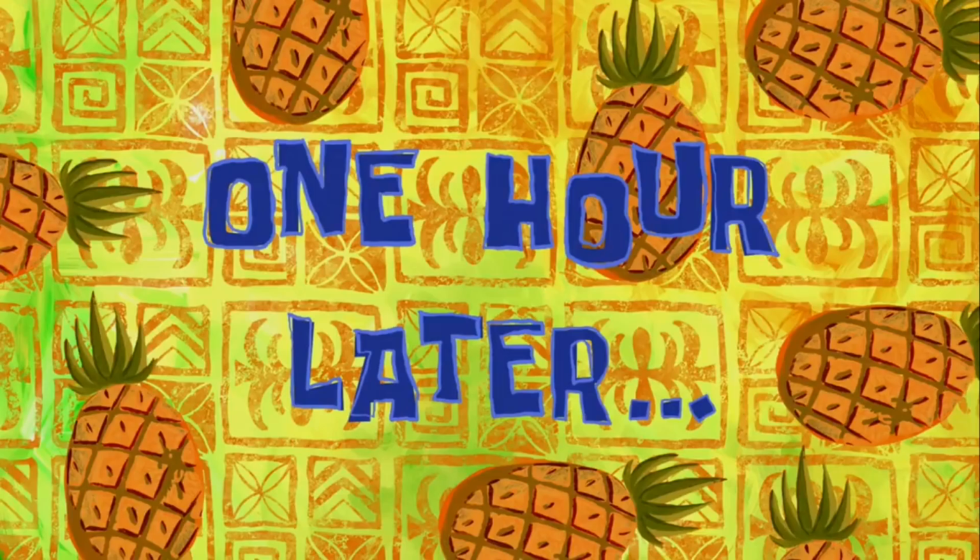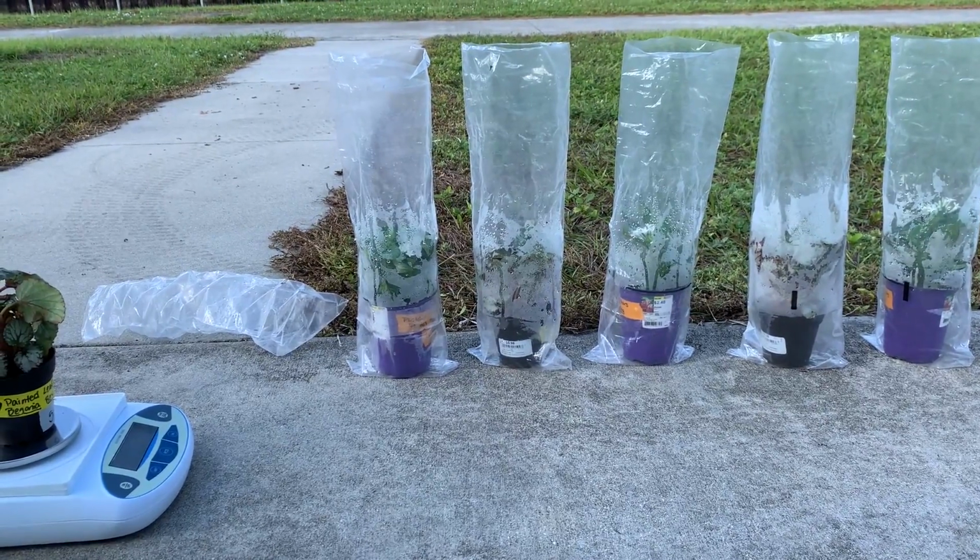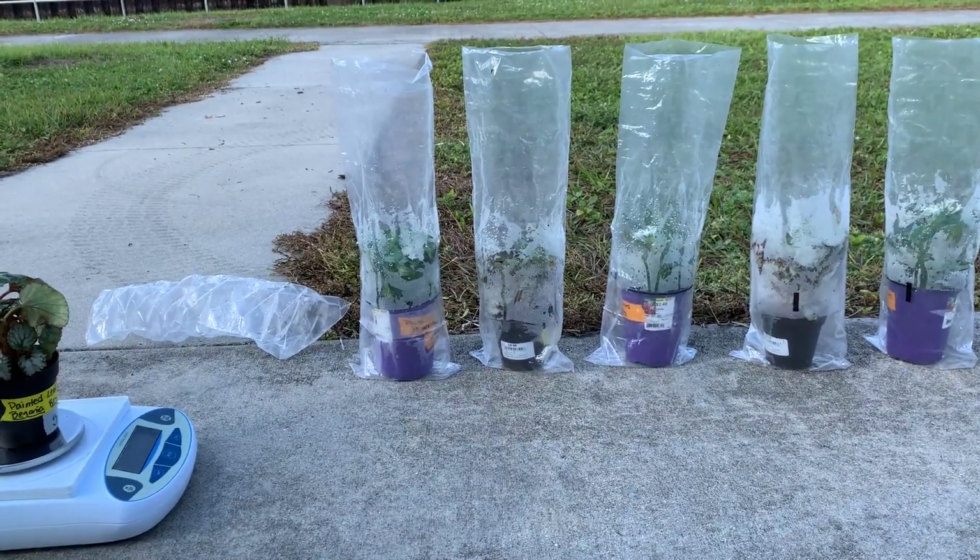One hour later. Okay, 3 hours has now passed, so I'm about to take our third and final mass for each of our plants.